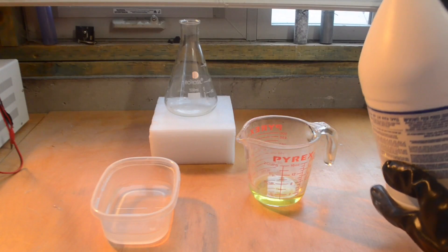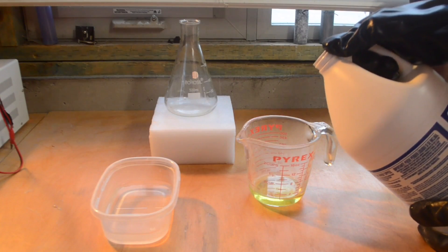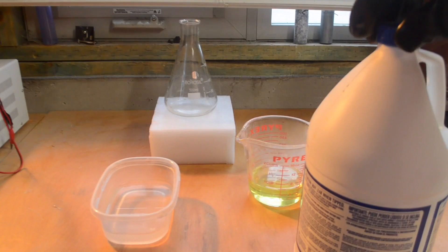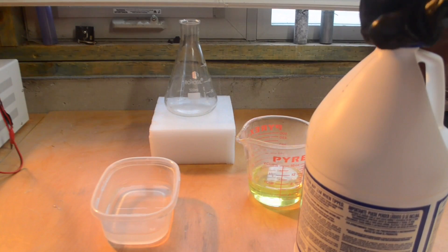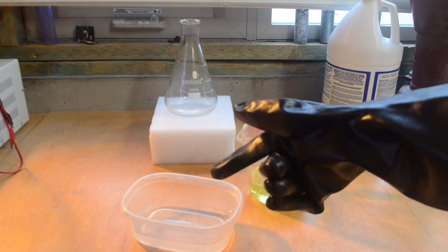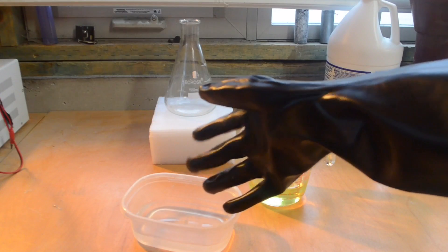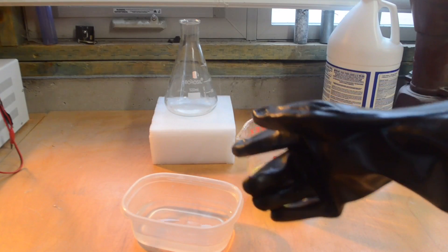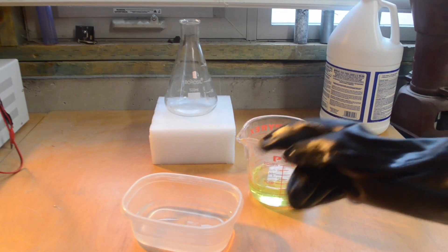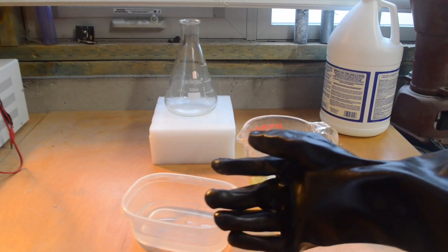So now with my goggles and gloves on, I'm going to pour some of this muriatic acid into this smaller container. After you pour it, be sure to seal up the top again so that it doesn't spill anywhere. Also note that as an extra safety precaution, I have this solution of baking soda and water over here — basically, if I spill any of this acid onto me, I can dump this baking soda water onto me to neutralize the pH.